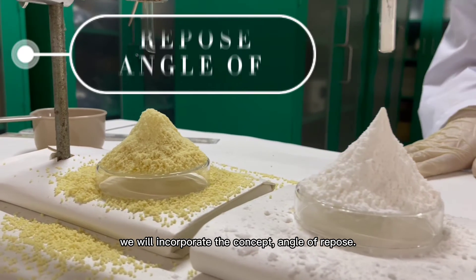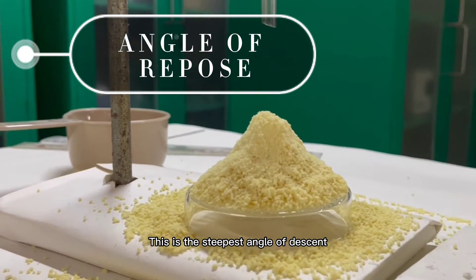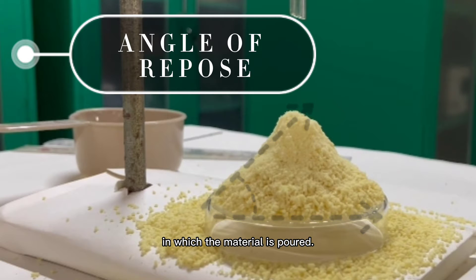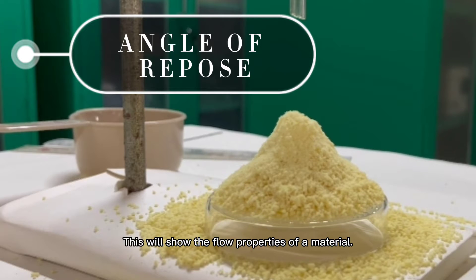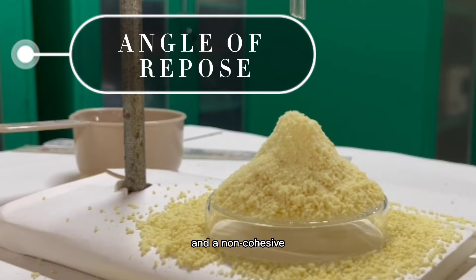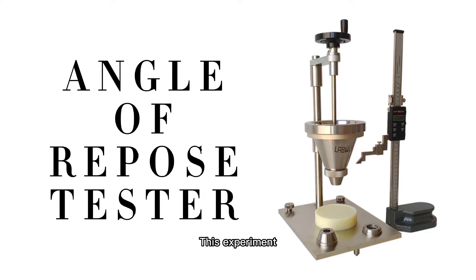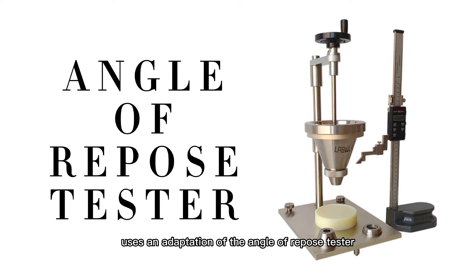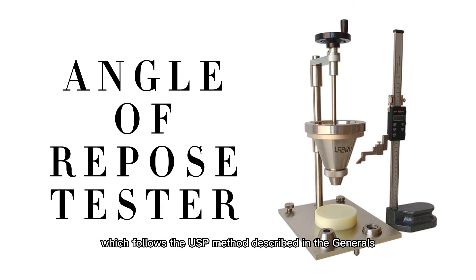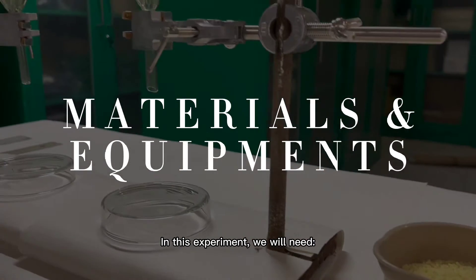In this experiment we will incorporate the concept of angle of repose. This is the steepest angle of descent relative to a horizontal plane in which the material is poured. This will show the flow properties of a material. A cohesive material will form an irregular heap and a non-cohesive material will form a regular conical heap. This experiment uses an adaptation of the angle of repose tester which follows the USP method described in general chapter 1174.